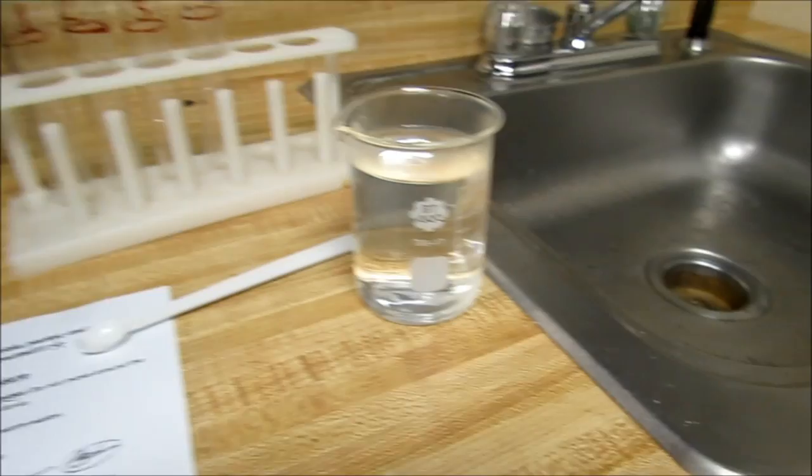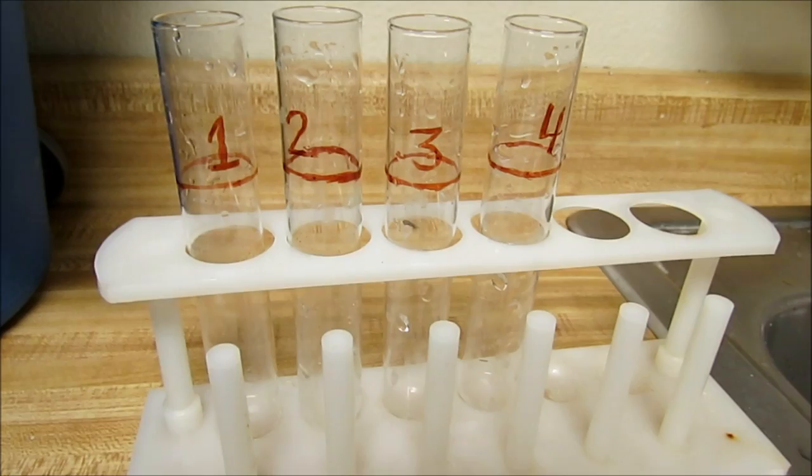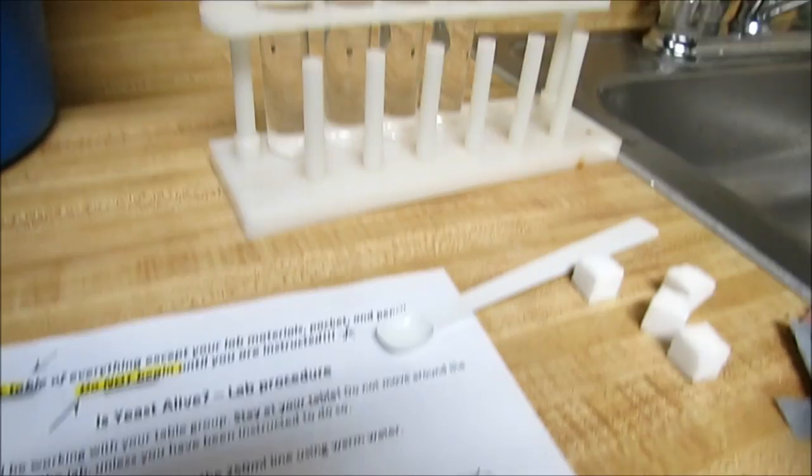I'm going to use the hot water that I got from the sink and fill up each tube up to the line. Okay, now my tubes are full of warm water.